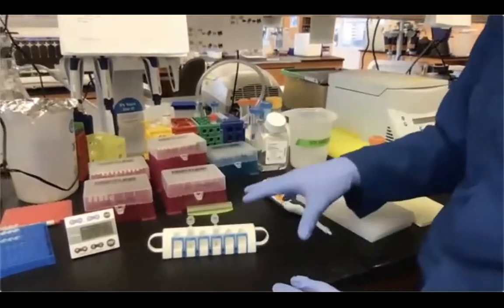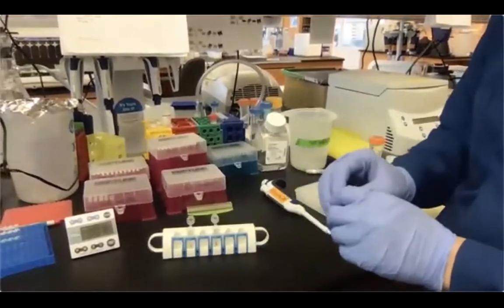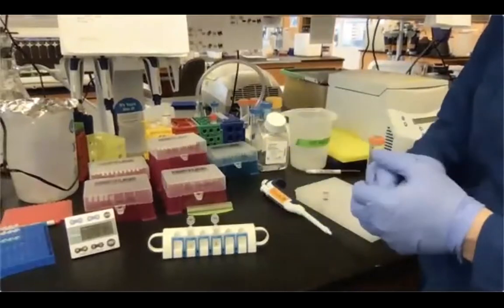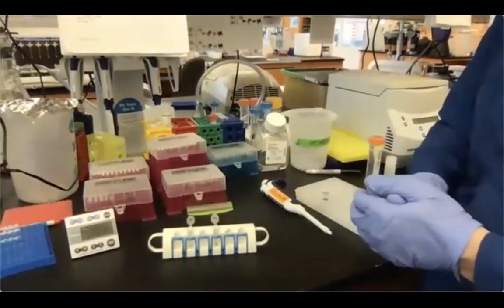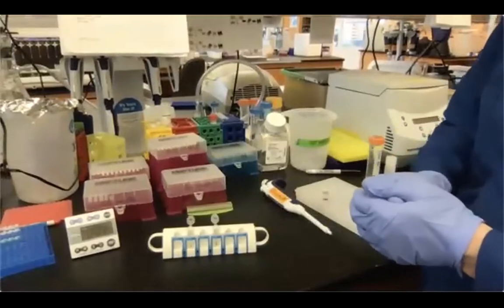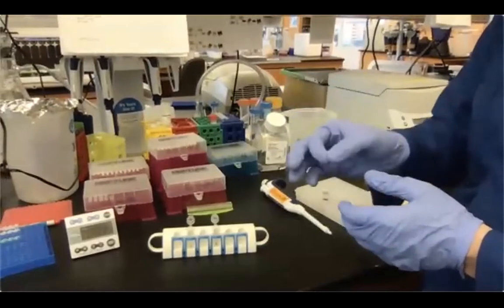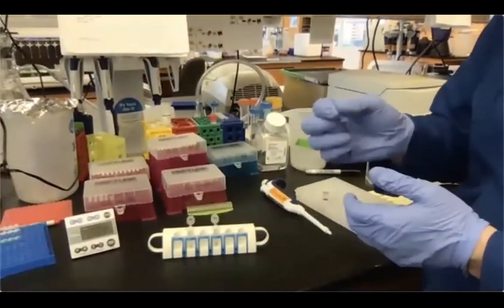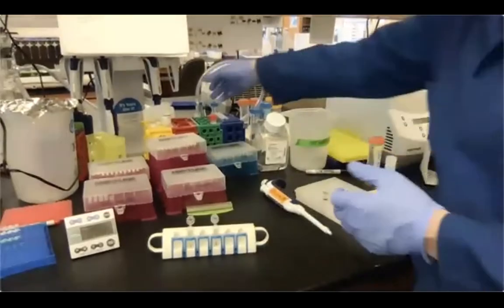Why do I want to wait a couple minutes? So the vacuum aspirator is really fast in removing the ethanol. So it's possible that some ethanol that is still on the walls of the tube slowly comes down to the bottom of the tube. So that's why I usually want to wait a couple of minutes. And then I'm not only going to the bottom of the tube with my vacuum aspirator to remove everything else, I'm also looking for some other droplets that are on the walls of the tube as contaminant.